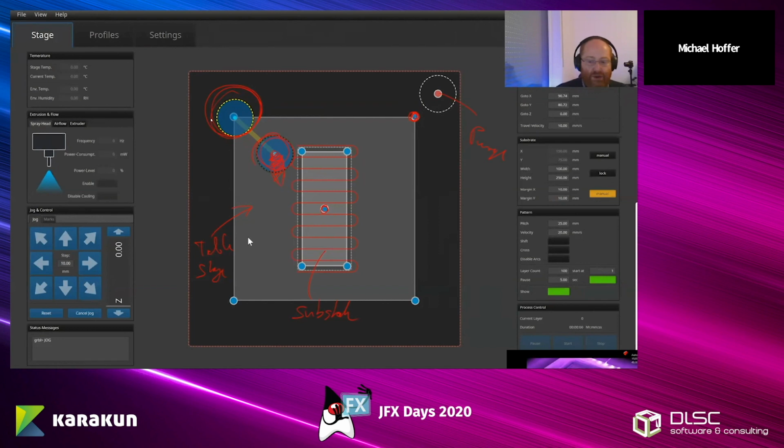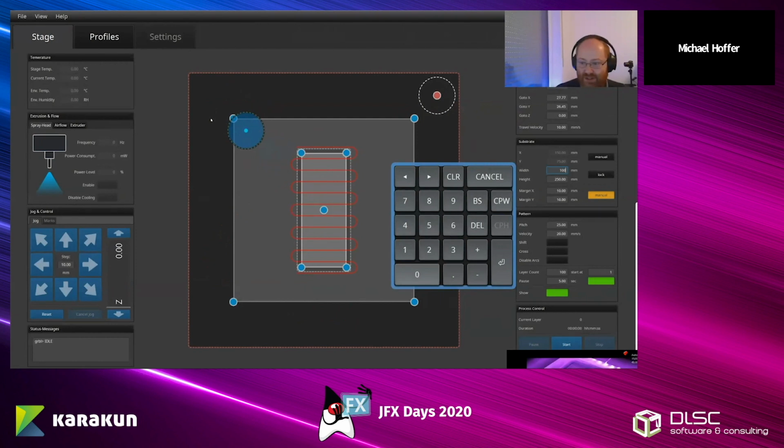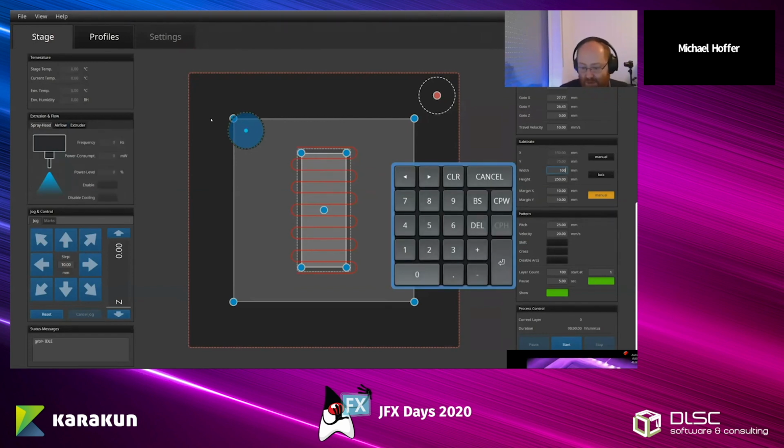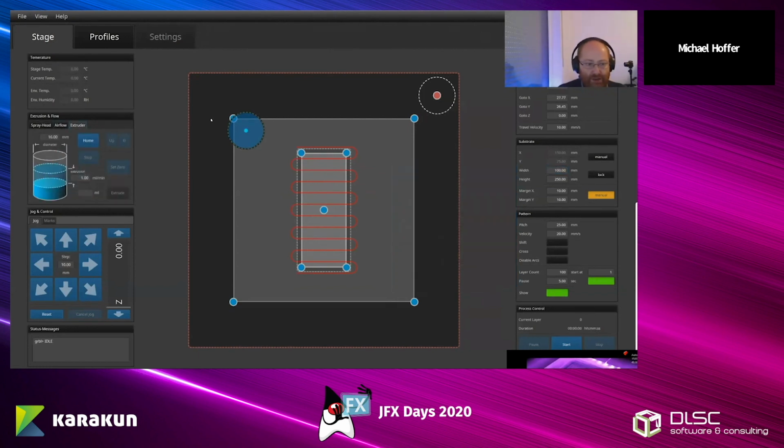And the overall look and feel, as we would have called it in good old Swing days, is actually not that far from the default, I think Caspian or Modena it's called. It just uses different accent colors, etc. And this was really nice for us because we didn't have that much time, but we wanted a dark mode kind of look. And that was really simple to accomplish, actually. So what you see here is a really nice number keypad. And because everything should be touch-based, yeah? So there's no mouse or keyboard interaction here. I mean, of course, you can use a mouse and keyboard, but you don't have to. And there is some tabs in the user interface, and you can see there are some other controls.